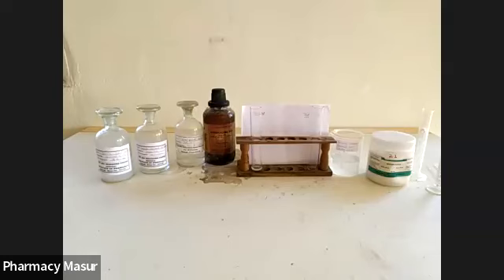As we all know, in the limit test of sulfate, soluble sulfate ion reacts with barium chloride in the presence of an acidic environment. Then it will produce barium sulfate as an insoluble precipitate, which will produce a turbid solution. We have to determine the turbidity of the solution. If the turbidity of the test solution is greater than the standard solution, then our test doesn't comply. Or if the turbidity of the test solution is smaller than the standard solution, then our test is compliant.